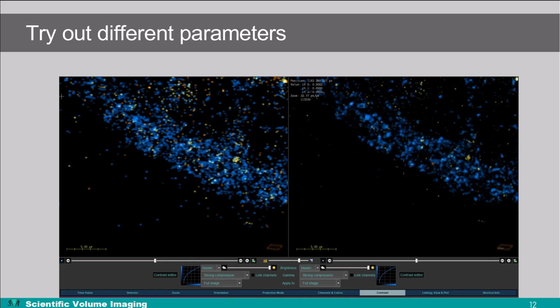And when applied correctly, this can show you much more detail in the resulting images. So instead of the blobbier images on the left, you can get a really good image to do your analysis on. And now let's go back to Huygens Professional again, where I have another example ready.